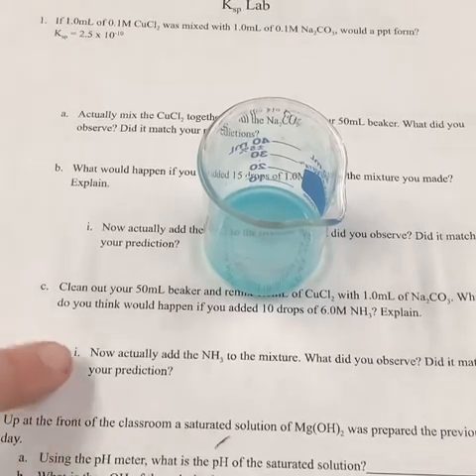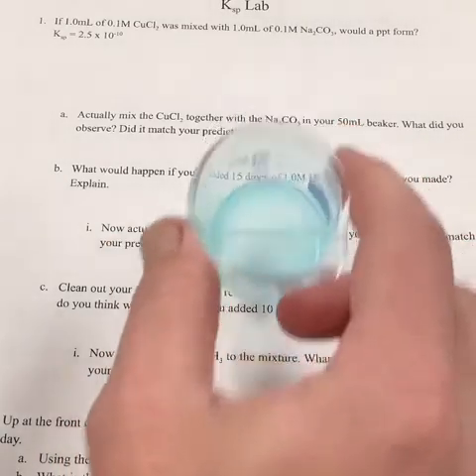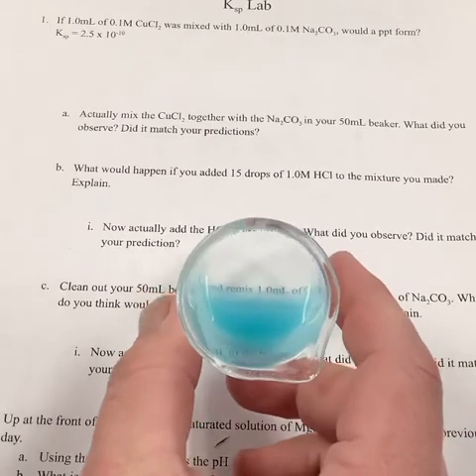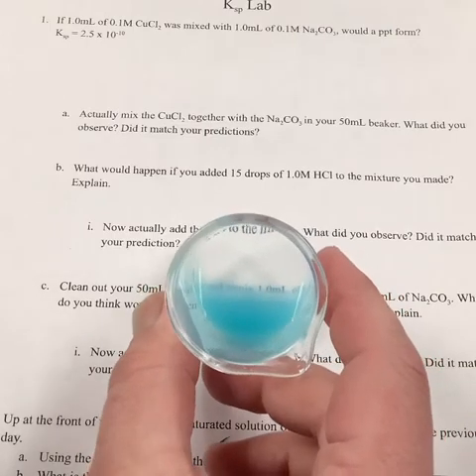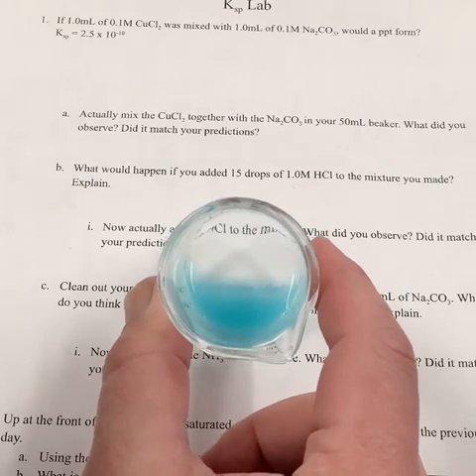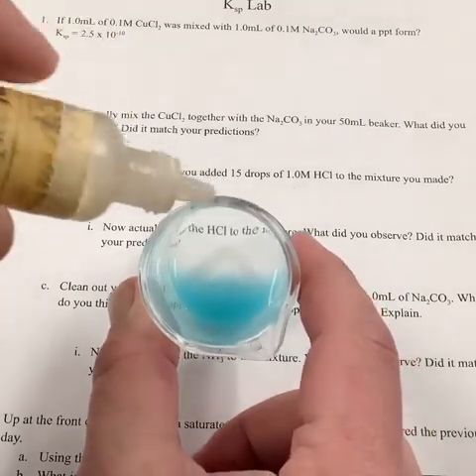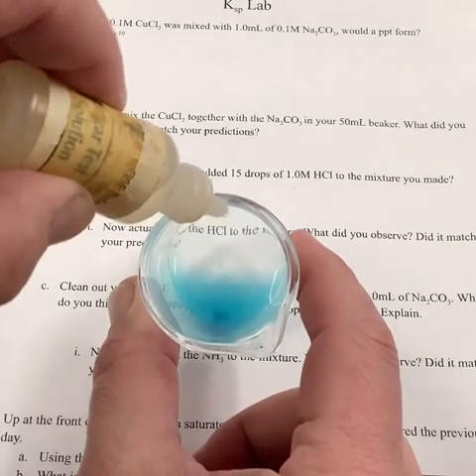So we're now moving down into actually adding the NH3 to our mixture. So this time we have a bottle of ammonia, and this stuff is a mess. It's a little powder everywhere. So when we look at it, let's try and get on the borderline there. Again, we can kind of see some of the clear, a little bit of the foggy. We're going to add the NH3, see if that print gets harder to see or easier to see or stays the same. So we'll start putting a couple of drops in.